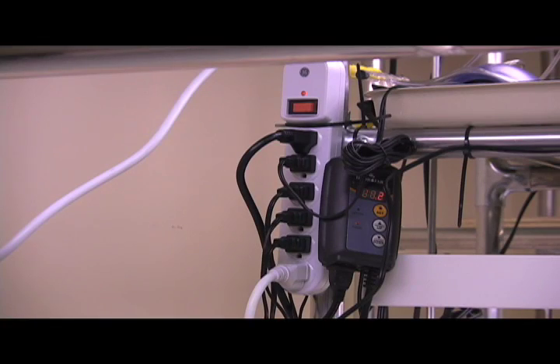We attached a surge protector to the side of each cart in order to keep all of the plugs organized.